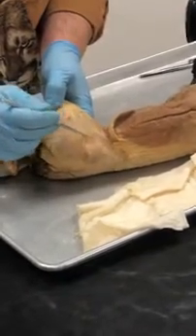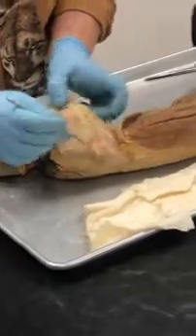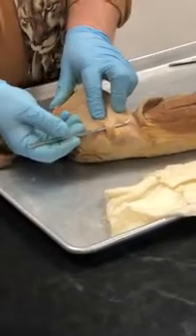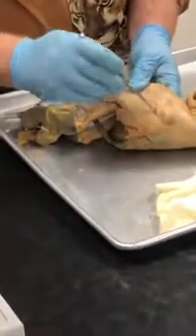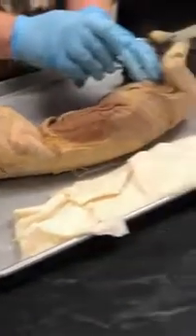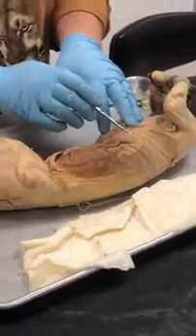Just bigger, which is the gluteus medius. Gluteus medius. And then this little one over here is the gluteus maximus. So yes, a cat doesn't have a big bum bum. Its gluteus maximus is smaller than its gluteus medius. Kind of similar to what we saw with the pectoralis major minor. Major being smaller than the minor. Okay?